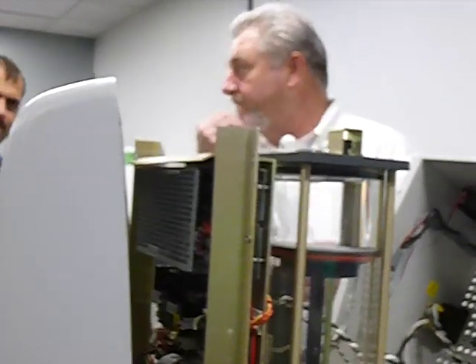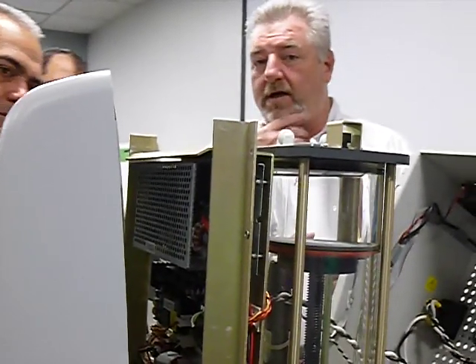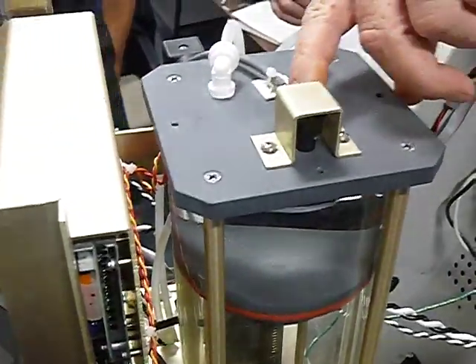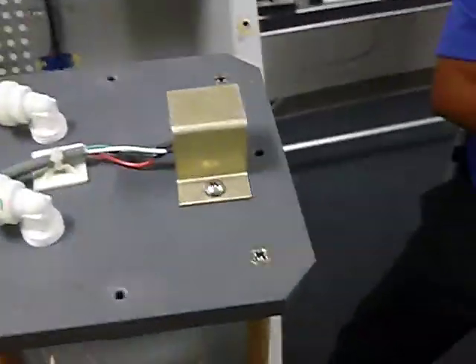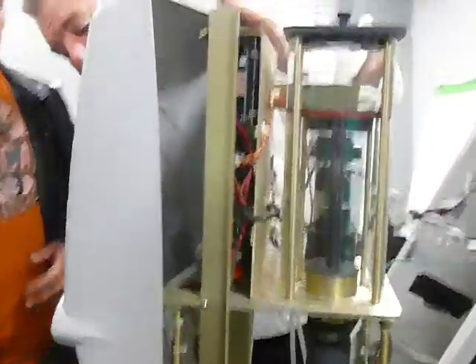How can we find out where the pressure is, what it's reading on the pressure? There's a pressure sensor inside. Yep, this is the pressure sensor, and the vacuum sensor is right under here, okay? That reads the pressure in the vacuum. Can we move this a bit front? Sure. We're just gonna perform a wash on it. Get rid of that error.